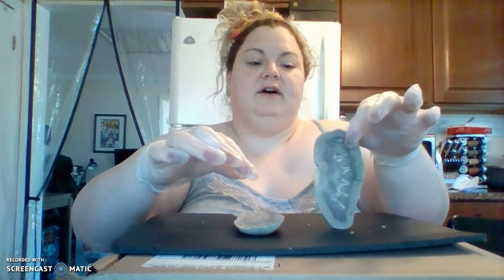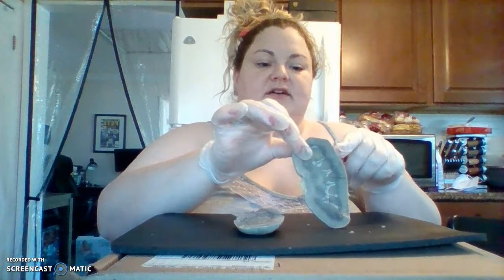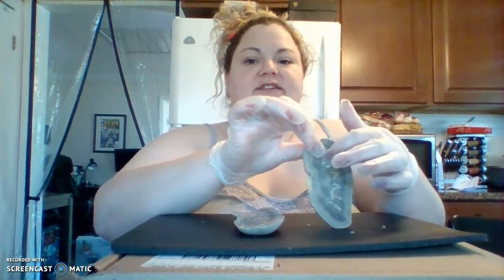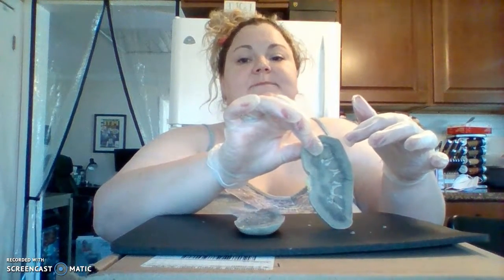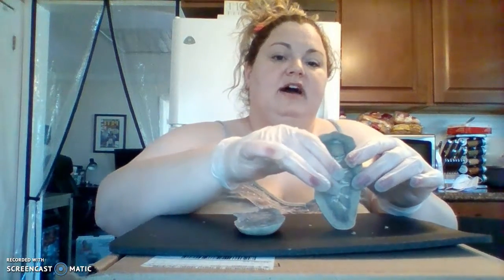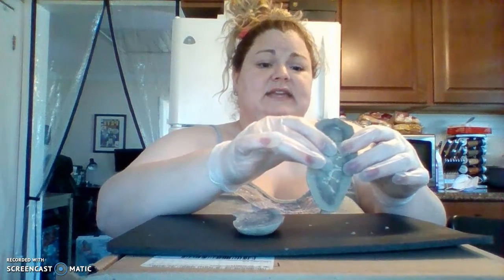We have the cortex up here of the kidney. And within these areas, we have the medulla pyramids, and the columns are also located within over here. We have our renal sinus, which I know is located in here.